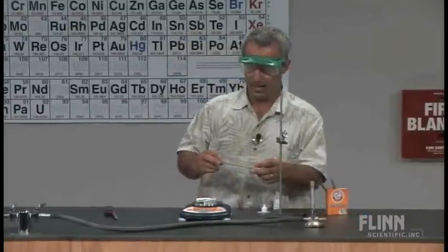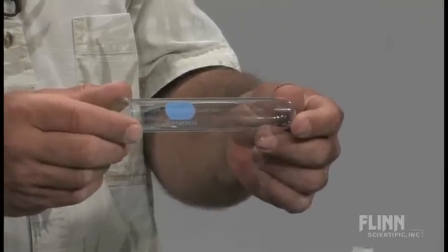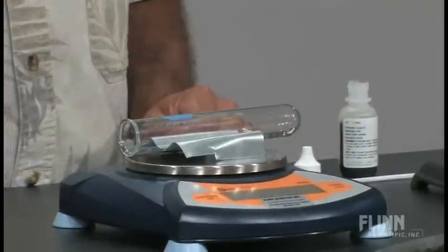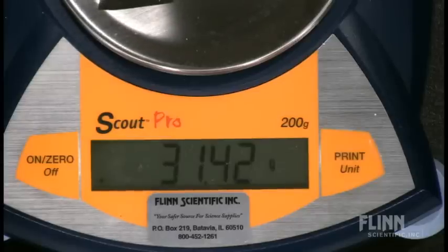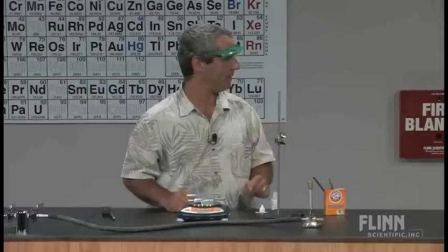So here's what it starts with. It starts with a nice Pyrex test tube, and we've got the little holder for that so it doesn't roll off. We're going to write these down. 31.43 grams for the mass of the empty test tube.